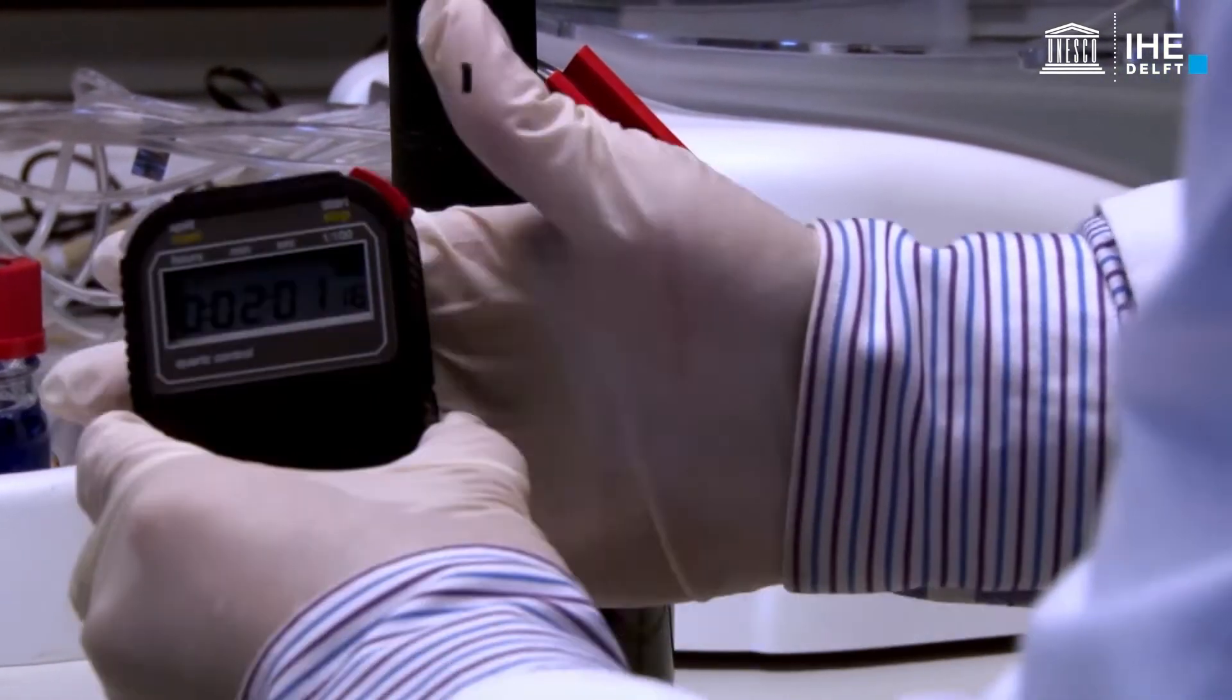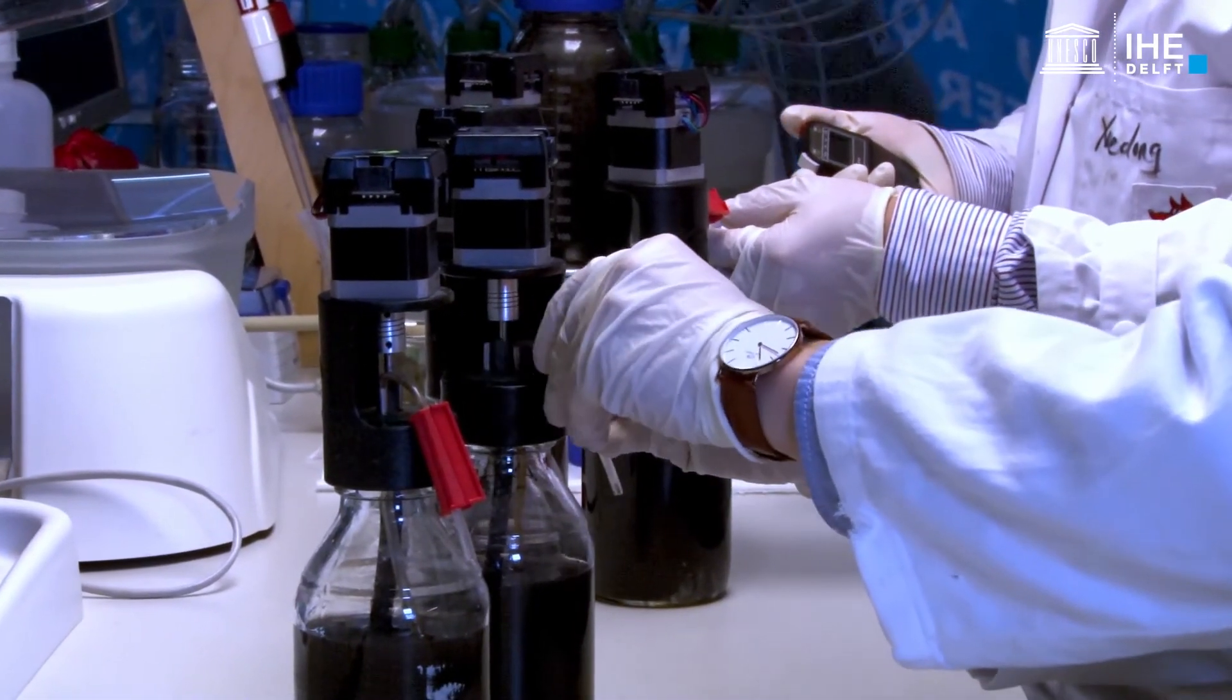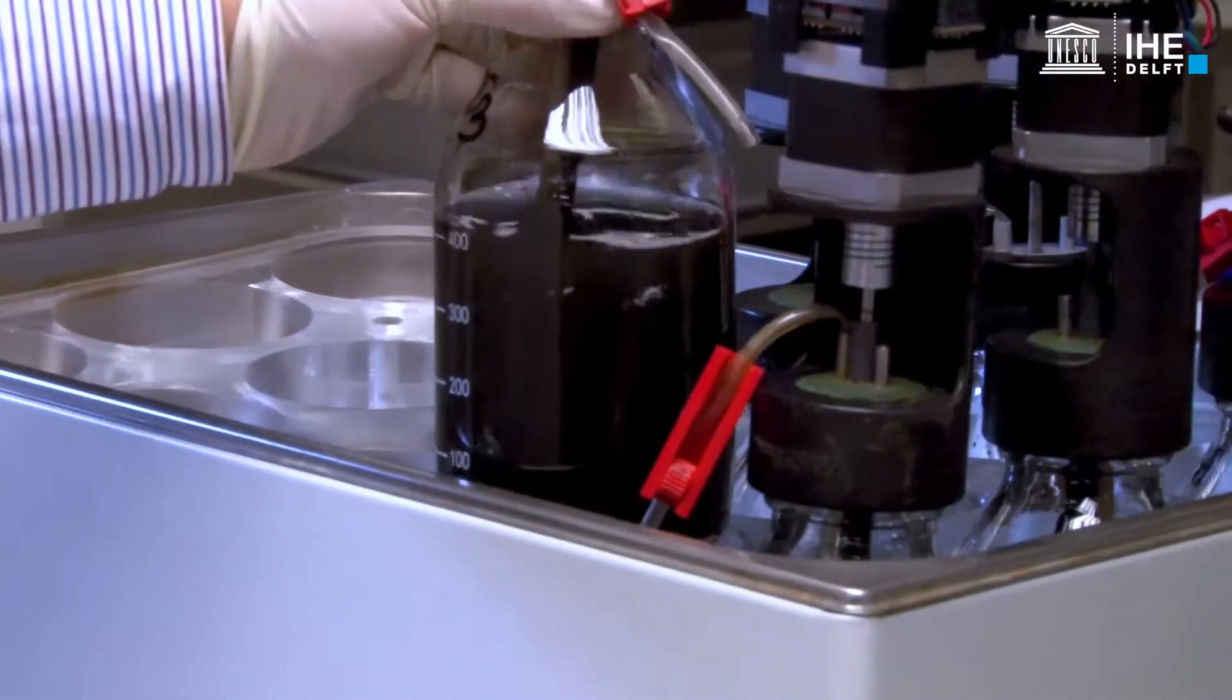Close the red valve. In the same way, prepare, assemble and purge all the bottles.